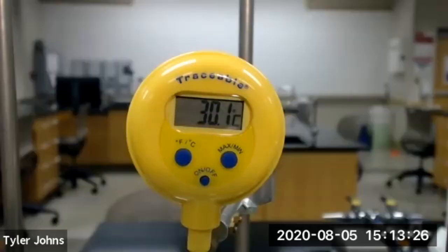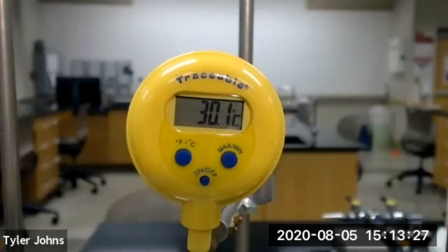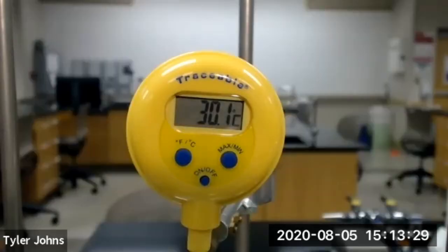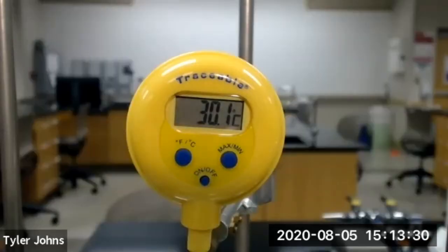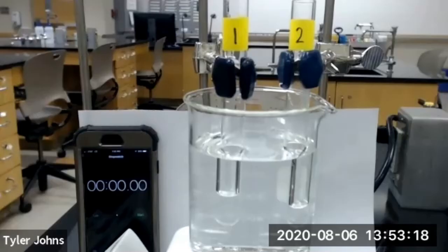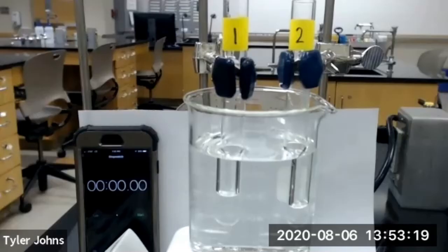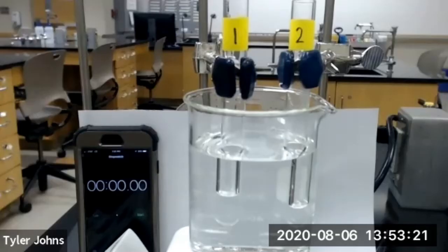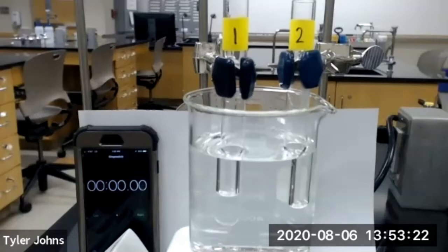The initial temperature for our reactants of trial number two is 30.1 degrees Celsius. We'll now start our reaction for part B, trial number two.